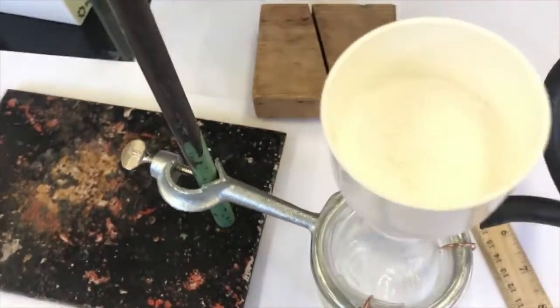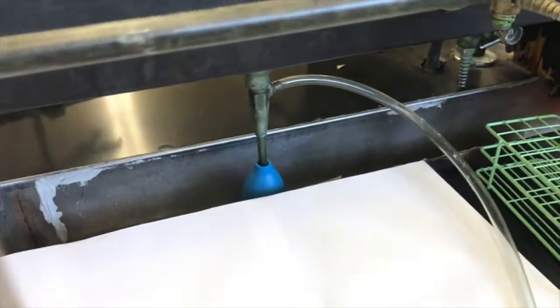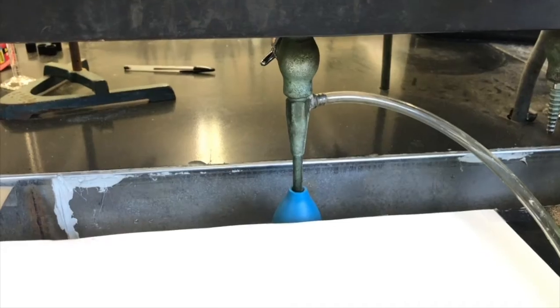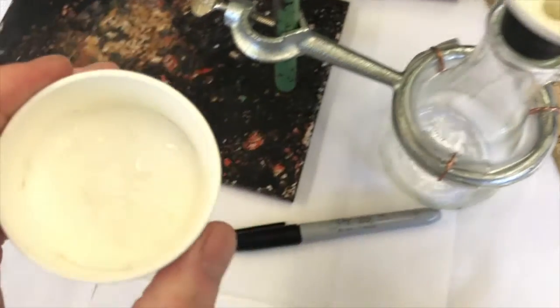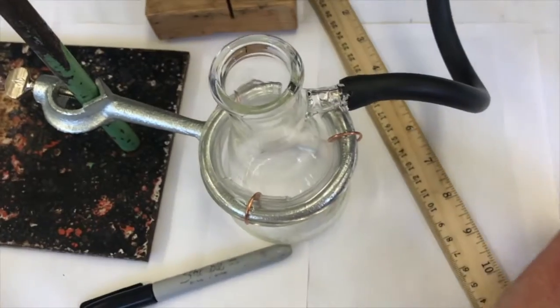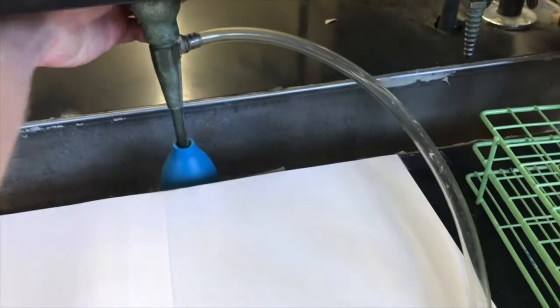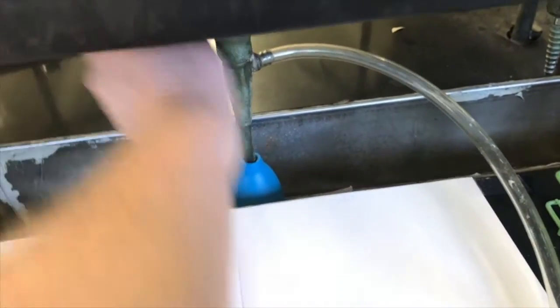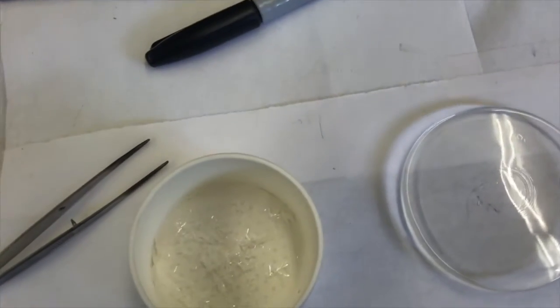I think this is dried under vacuum long enough. So should I turn off the vacuum now? Should I turn off the water aspirator while it's under vacuum? No. I want to first remove this top of the filter flask. And I can even take this out if I want to be really sure of it. Now I know there's no vacuum here or here. So when I turn off the water, I won't get a backflow of water through the tube. And this guy, I'm going to take and carefully remove the filter paper and its crystals and put it on this clean watch glass.